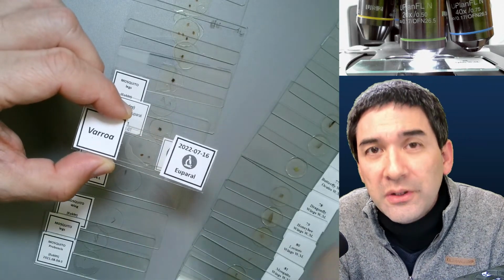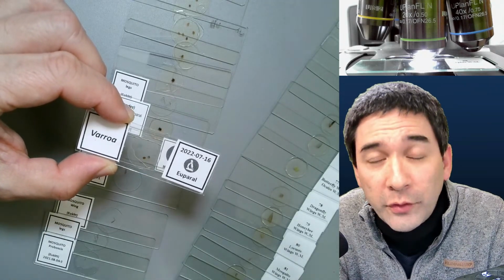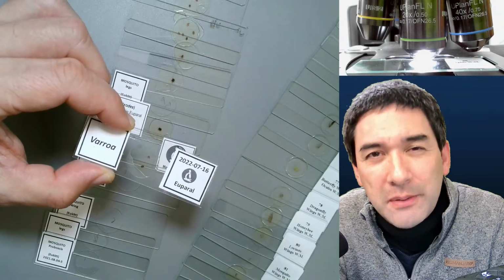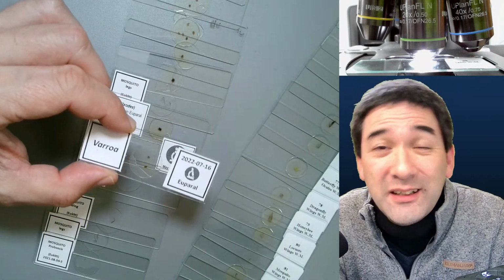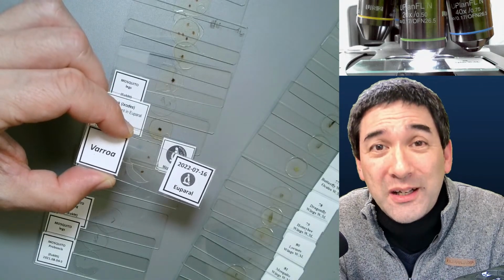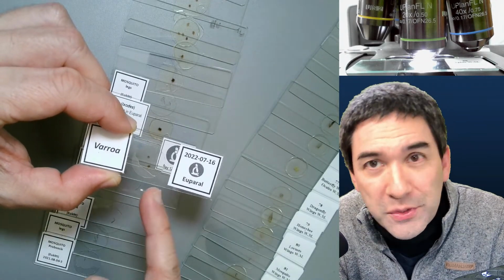So it has this built-in clearing activity, and there is a second advantage of using Euparal. What you do is you put the insect into alcohol to dehydrate it, to remove the water, and to disinfect it and make sure that it's free of bacteria. Because if bacteria are left on the insect, and there's some water left, then the bacteria can break down and decompose the insect, and then you get bubbles forming, decomposition gases forming.